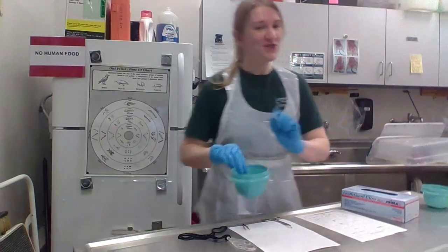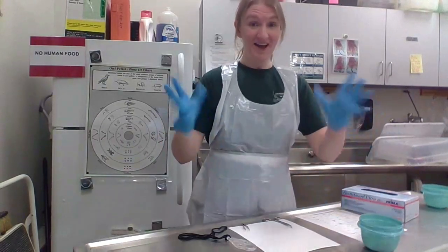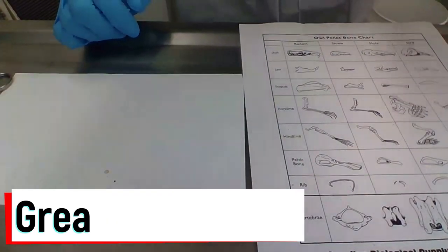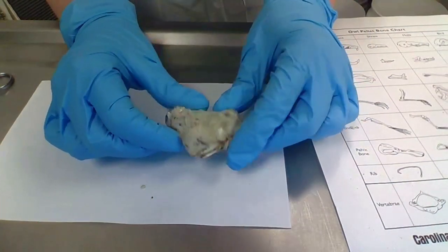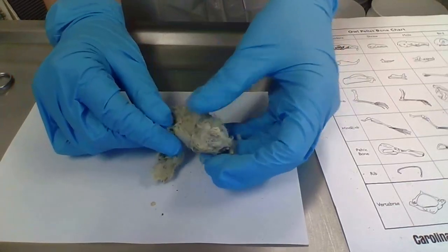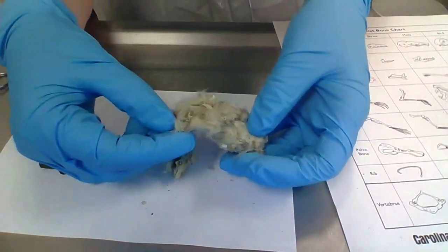Not just that one great horned owl was fed yesterday, so I have multiple pellets for us to look through. We have our gloves on and our table all ready to go. Let's take a look. Let's start with this nice big great horned owl pellet. I'm going to start by breaking it apart a little bit with my hands — you can see how all that fur is kind of compacted over the bones. Already, as I pull it apart, you can see some pretty big bones and it looks like a couple of pieces of rocks in there that might have gotten stuck on their food.